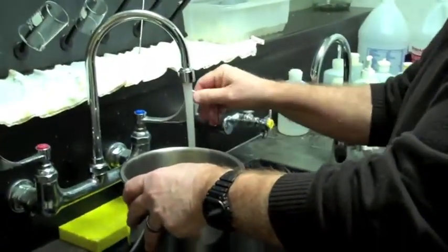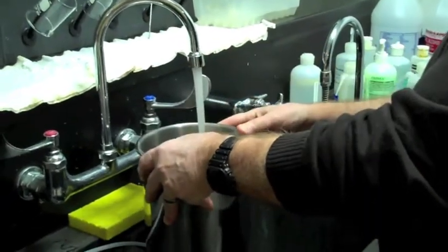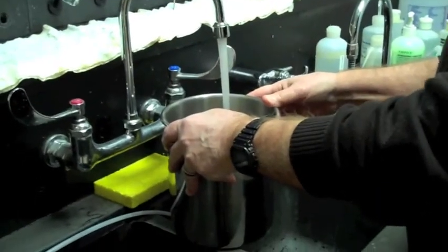So we're going to get this down to 19 centigrade? 19 degrees centigrade? Yes, exactly.